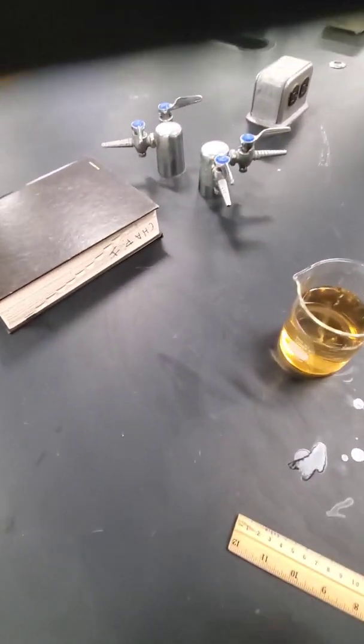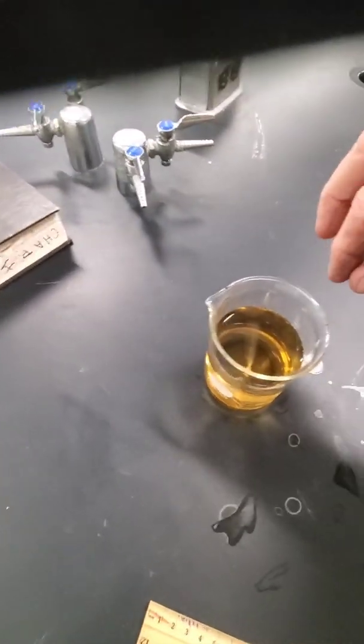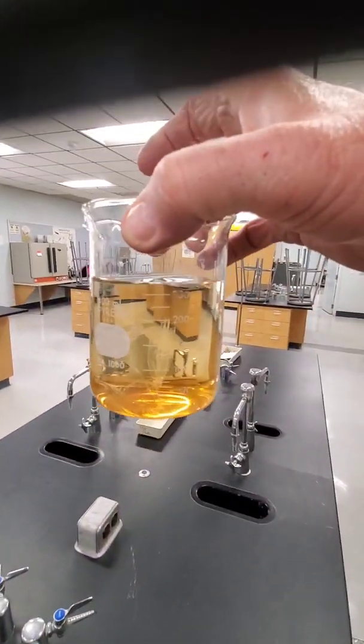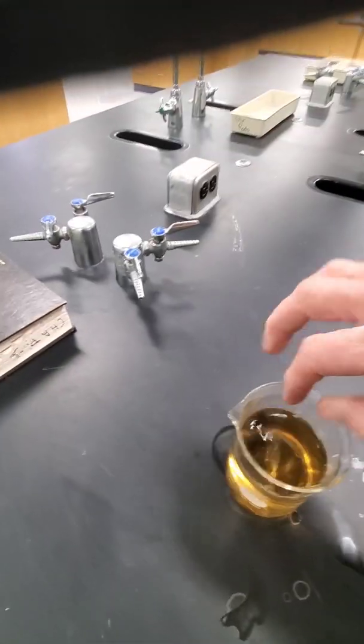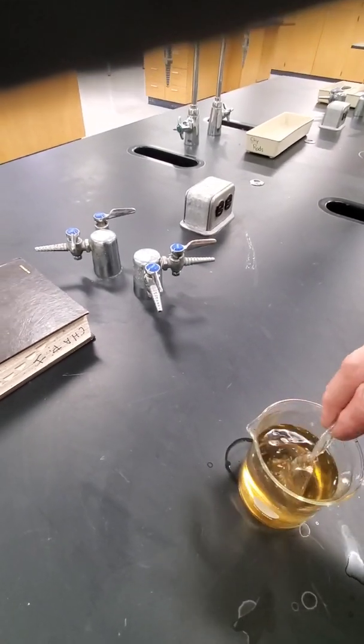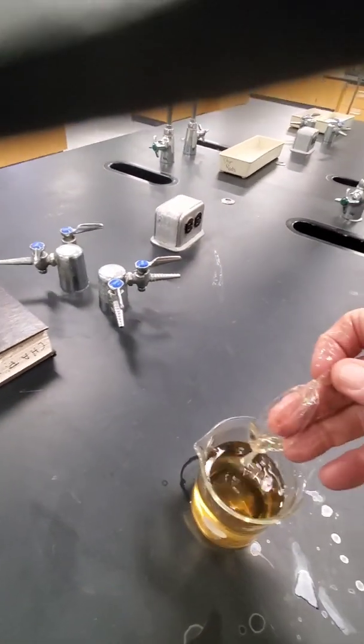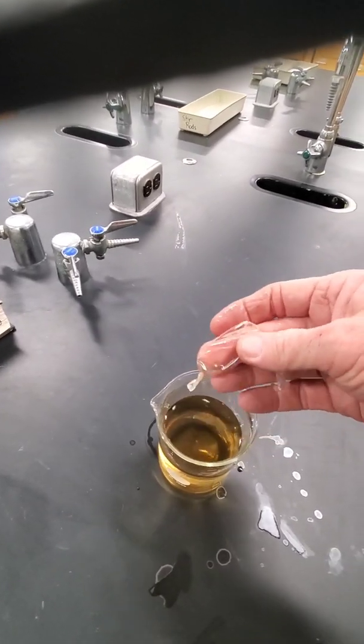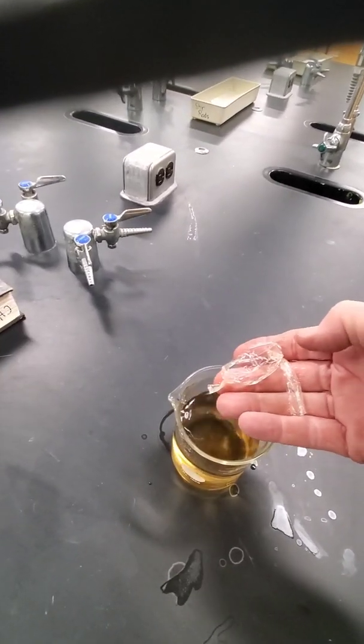Time to check our little tube again. Oh look what have we got, it looks like the water's all discolored now. What could have happened? And here's our little tube, you can see that it popped. It got so big, it swelled up so big that it just popped.